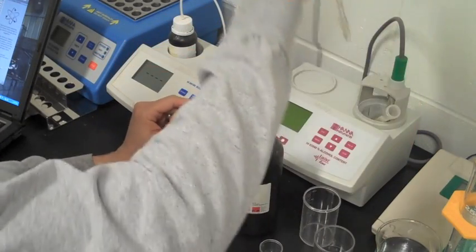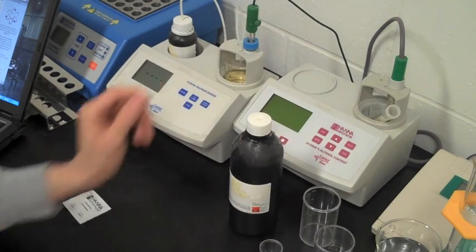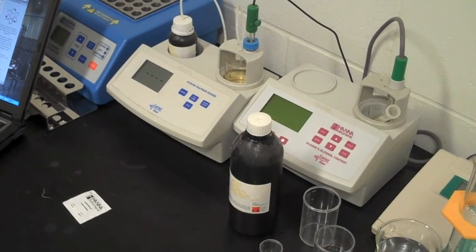You'll take the probe, make sure it goes all the way in there. You've got to add a stir bar to it.